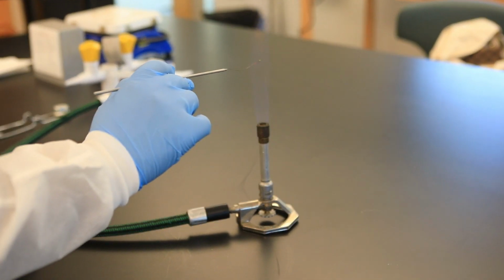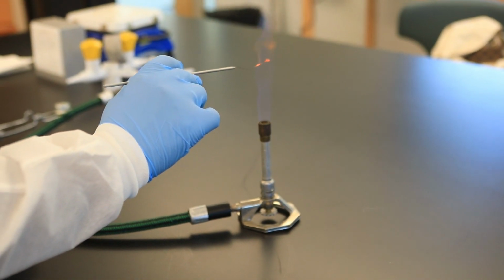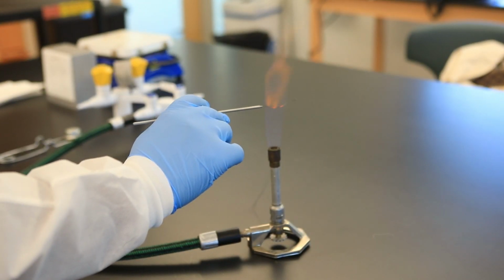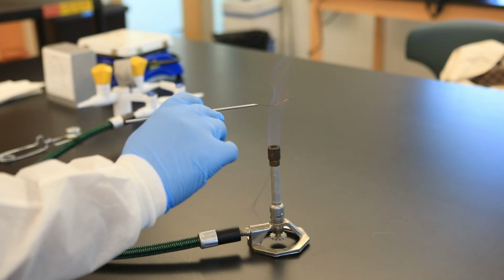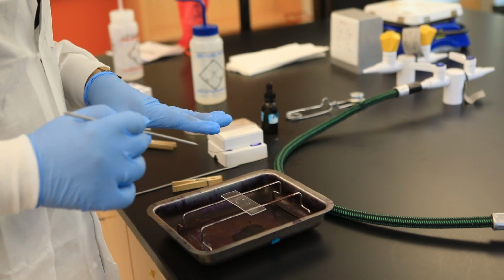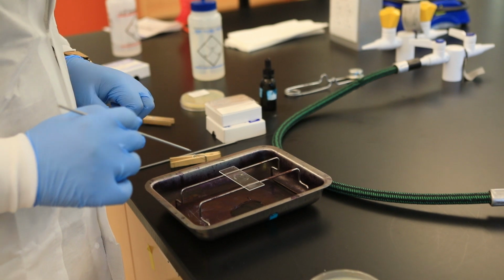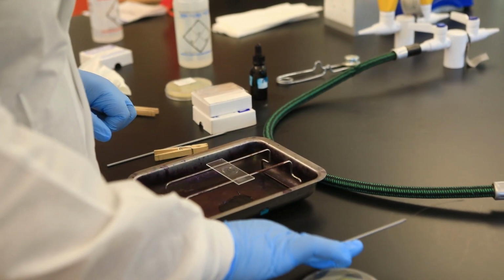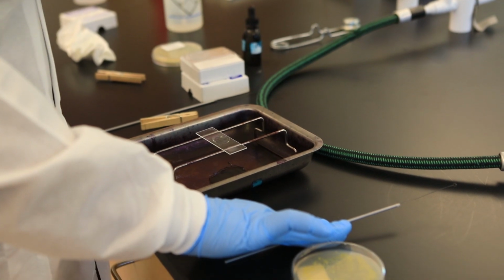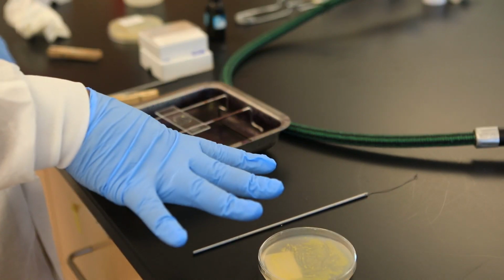For some microbiologists, they probably would not create the smear like that. Once you become very advanced and used to doing this, usually you just take the bacteria and introduce it into the middle, and if you need water, you mix the water in. But for beginners, I like to show this method of creating the smear. Okay, so you start off with these small semicircles and you gradually make the circle bigger so that the bacteria smear thins out. Once I'm done re-sterilizing the inoculation loop, I can lay it back down.